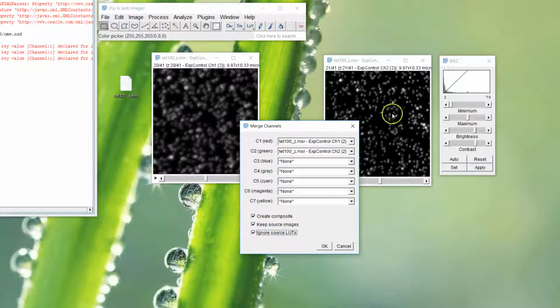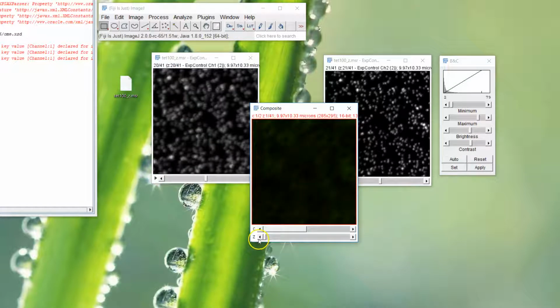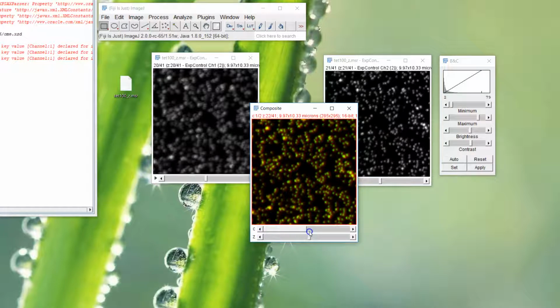When I've not checked that, the Z slider doesn't work sometimes, which is bizarre. And ignore these lookup tables so it colours them depending on the box you've put in here. So we'll do that, and so now we have our composite overlap there.